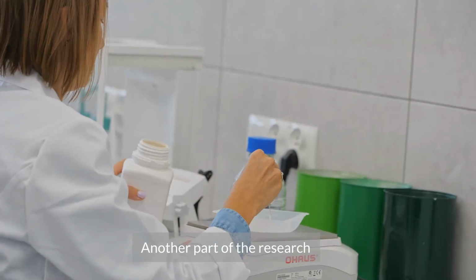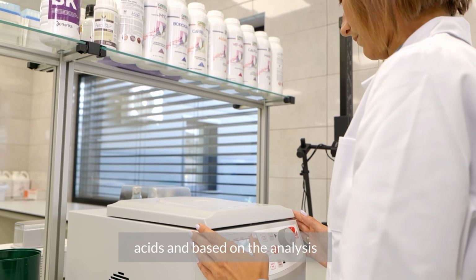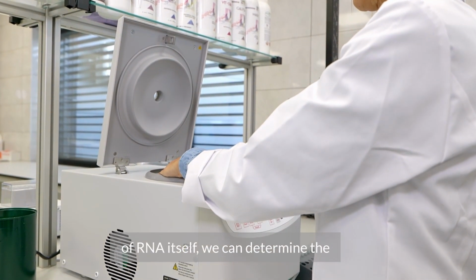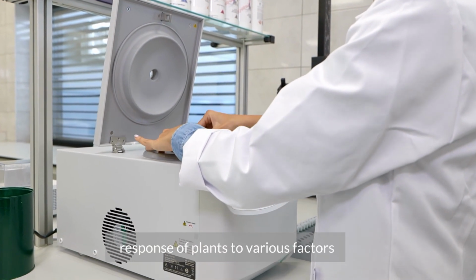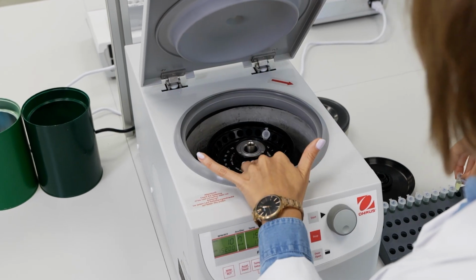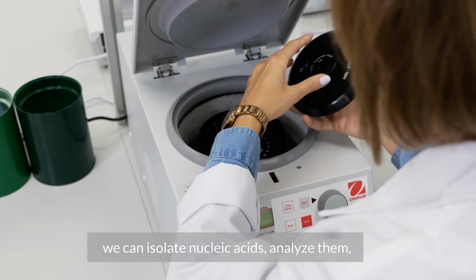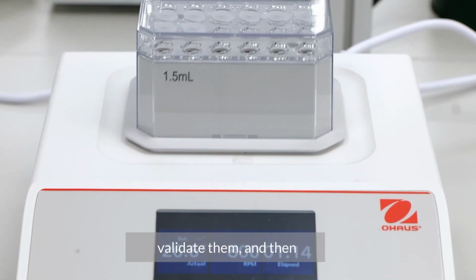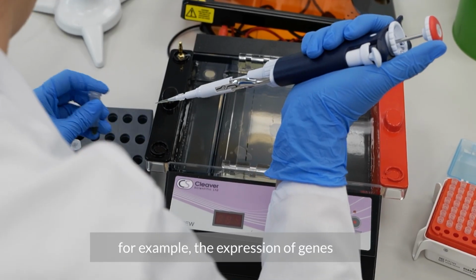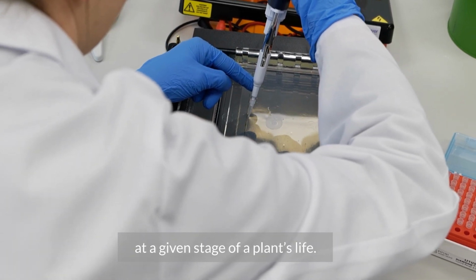Another part of the research is the experiments in which we use nucleic acid, and based on the analysis of the presence of nucleic acids, gene expression or the presence of RNA itself, we can determine the response of plants to various factors, be it physical or chemical. Starting from scratch, we can isolate nucleic acids, analyze them, validate them, and then very precisely and very accurately determine, for example, the expression of genes that are active at a given moment at a given stage of plant's life.